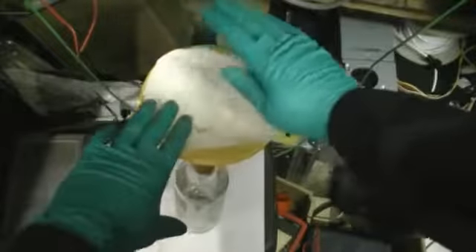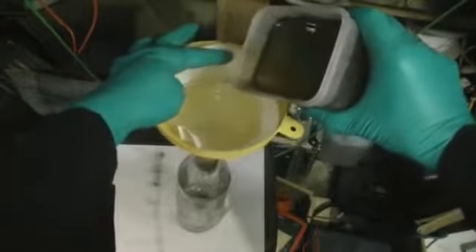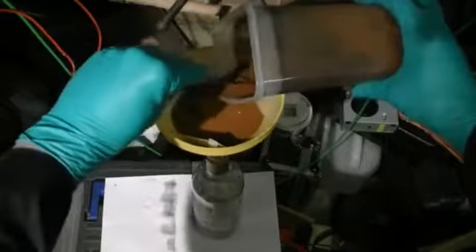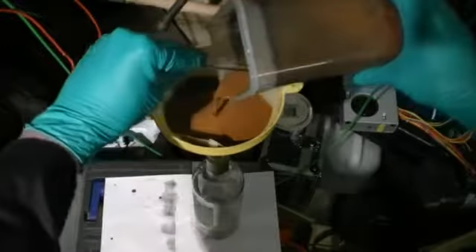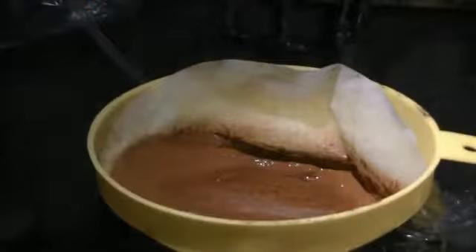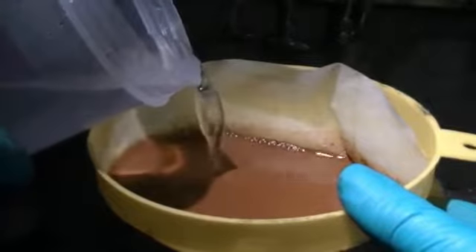Next, using a coffee filter paper, the solution is filtered. Taking care not to disturb the settled sediment, the liquid electrolyte is easily filtered off. Then, using a stainless steel spoon or spatula, it's quite easy to scoop out the product from the bottom of the container into the filter. Since copper oxide is not very water soluble, it is possible to wash away any dissolvable salts using demineralized water. When most of the water is drained through, we can then carefully remove our filter paper and allow it to dry.